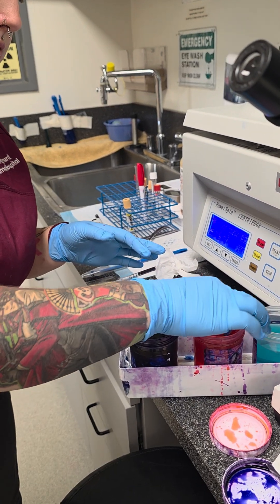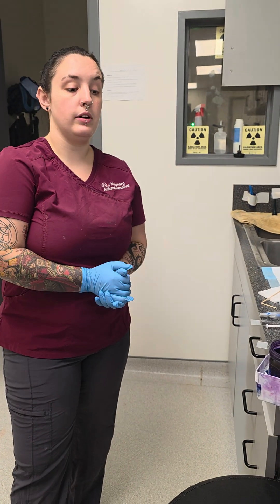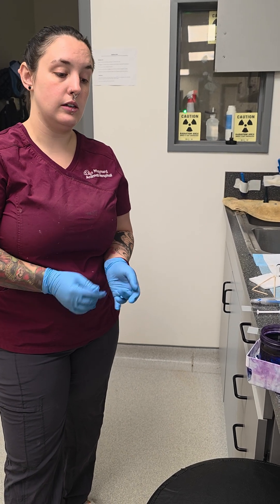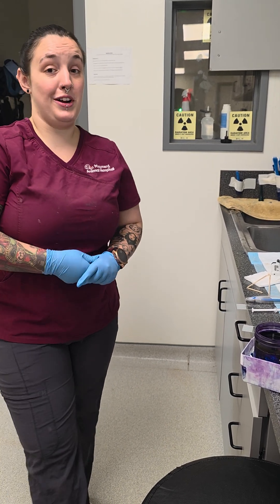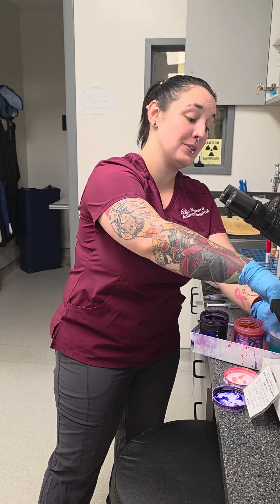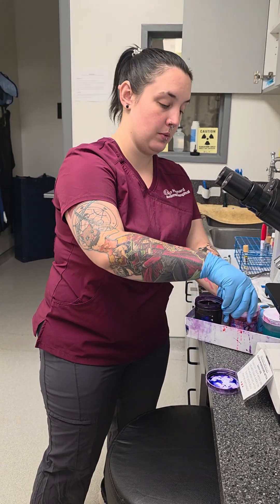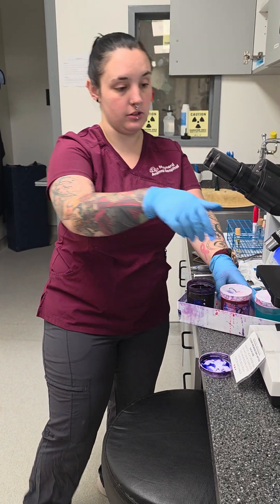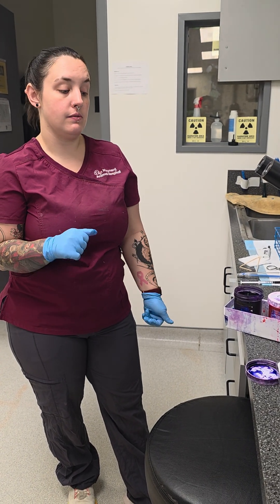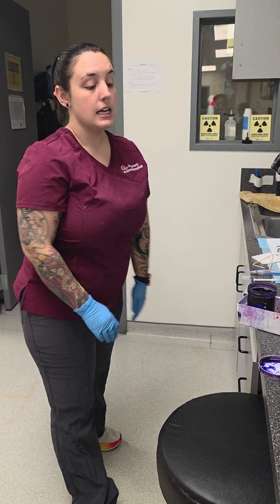I want the difference in all of this stuff. So we're going to sit there. If you can do 60 seconds, that'd be ideal. Counting 1 through 60. I like it super dark.